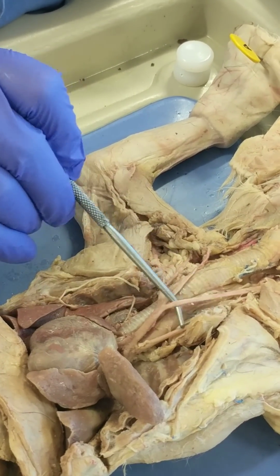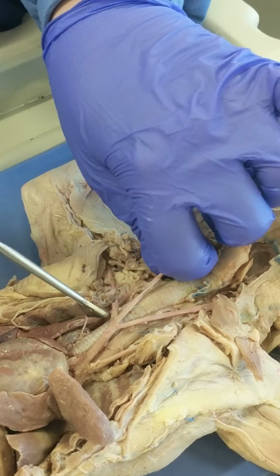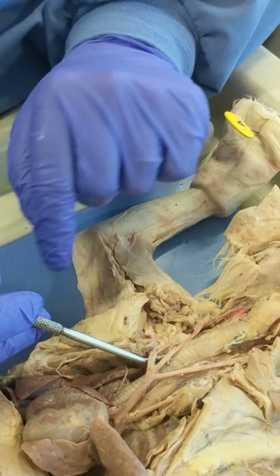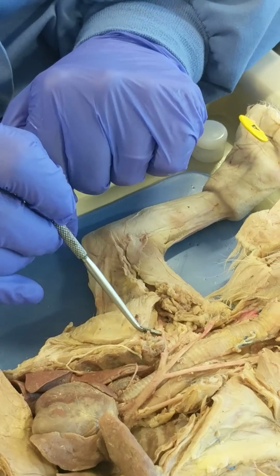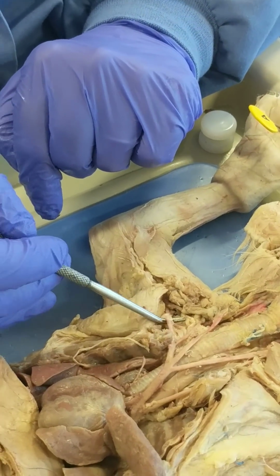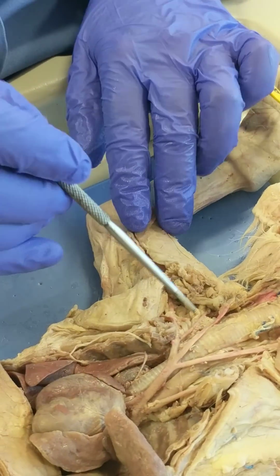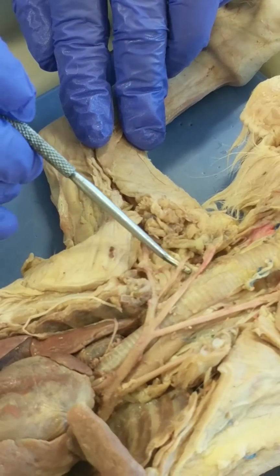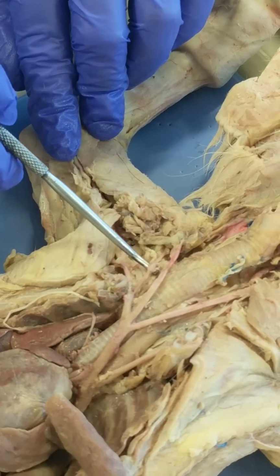This is the left common carotid. This is the right common carotid artery, and then this is the right subclavian. And after the subclavian goes around that first rib, right here, we would call that the axillary artery. The subclavian artery gives off two smaller branches or vessels. This one's the thyrocervical artery, but I think I crossed it off your list, so you don't have to know it, but it's really nice in this cat.